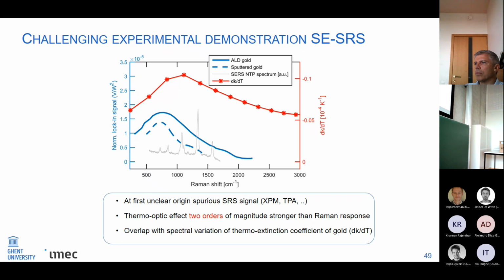And as you can see from the figure as well, here we also have this red curve, and we can see that our blue curves have this overlap in spectral variation with the red curve, which is the variation in the thermal extinction coefficient of gold. So basically, the absorption of gold changes when the temperature is also altered.